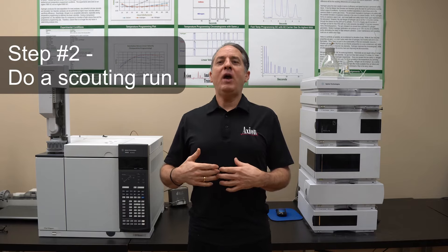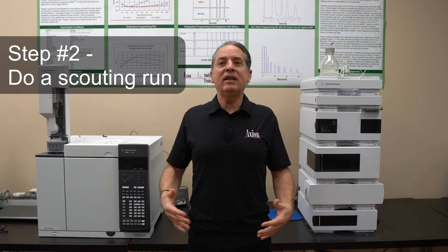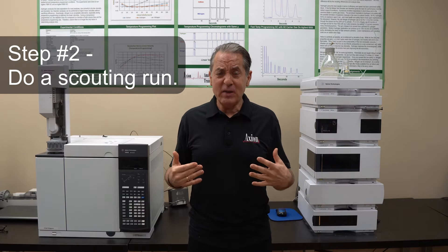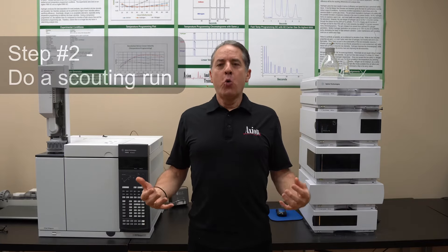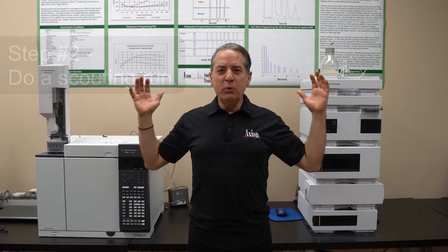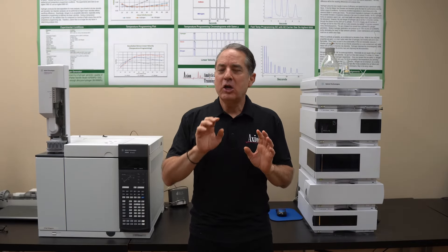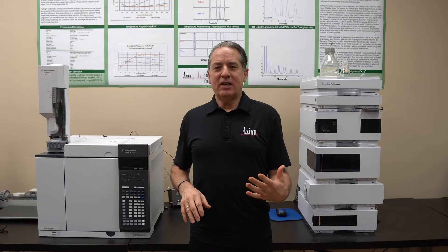Step two: if you have to start from scratch — if you have something that's totally unknown, something that's not in the catalogs — there's a really simple approach that we use in class to teach method development, and that is we're going to do what we call a scouting run. We're going to try every mobile phase in the world to see which mobile phase works. That sounds daunting, but we're going to do that in one injection. In 30 minutes, you're going to know a lot more than you did 30 minutes ago.